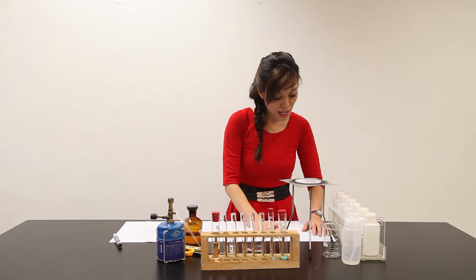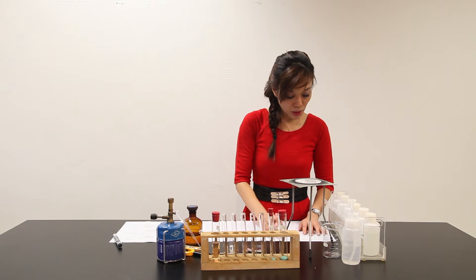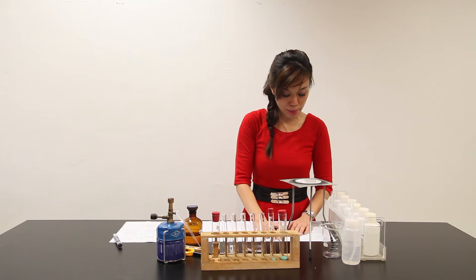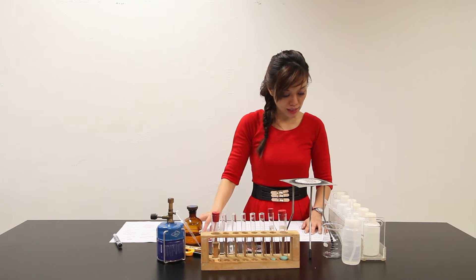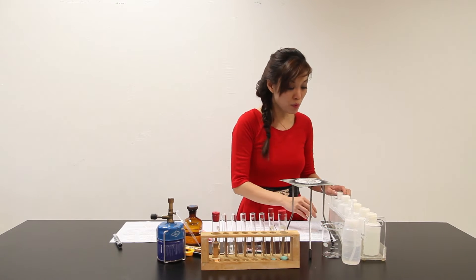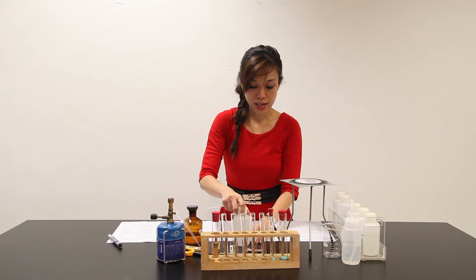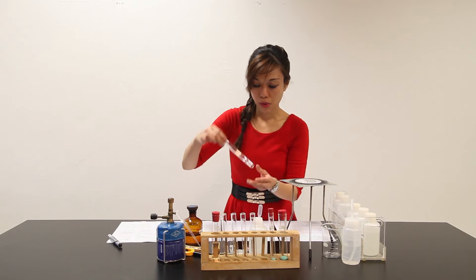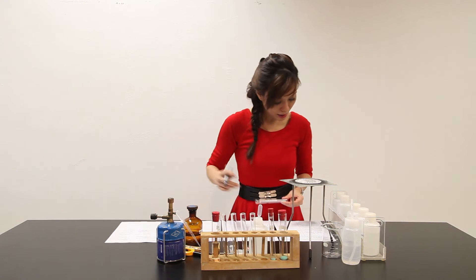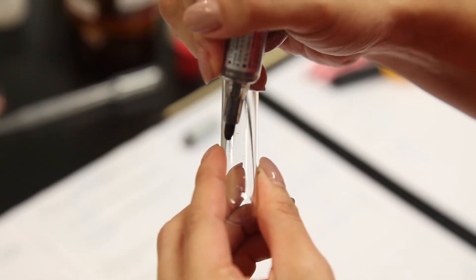Record your observations. You should test for any gases evolved, and the volumes given below are approximate and should be estimated rather than measured. Part A: place about 3 cm³ of lime water in a clean test tube. Lime water is actually calcium hydroxide. Let me put it over here, right in front. It says here, add about 3 cm³ — 3 cm³ is estimated to be around here.